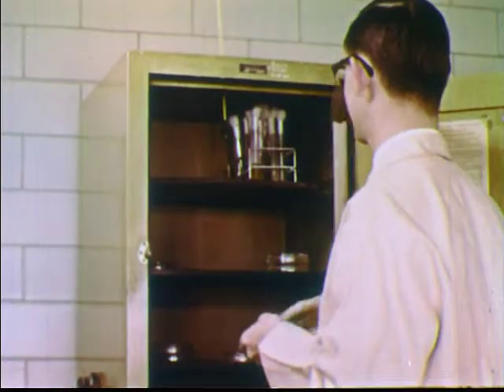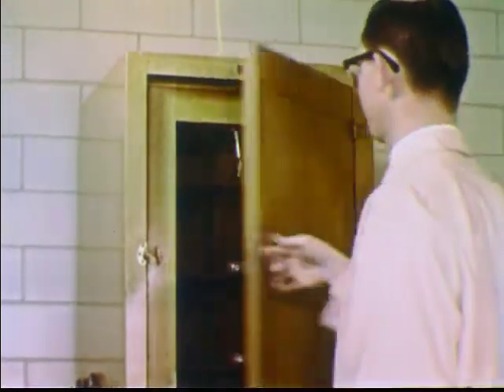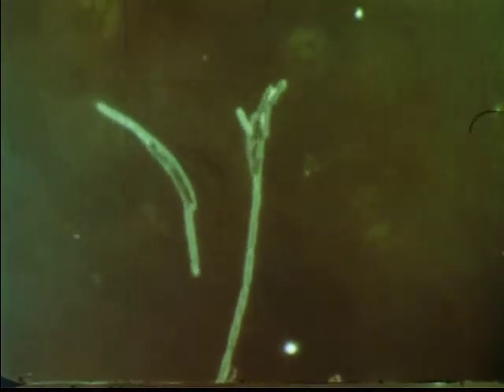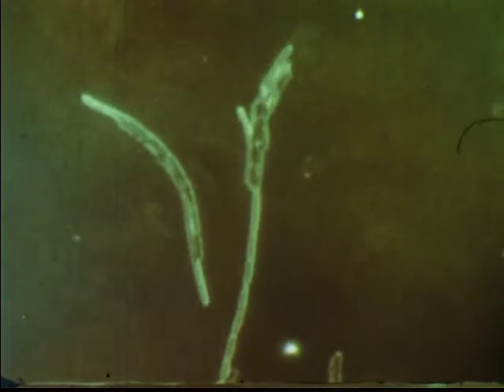After the nutrient medium has cooled and hardened, the dish is inverted and placed in an incubator which maintains a constant temperature to encourage growth of bacteria. During incubation, each bacterial cell in the soil sample grows and divides to form two new cells, as shown by time-lapse photography through the microscope. The division is repeated approximately each half hour. This method of reproduction is known as fission.